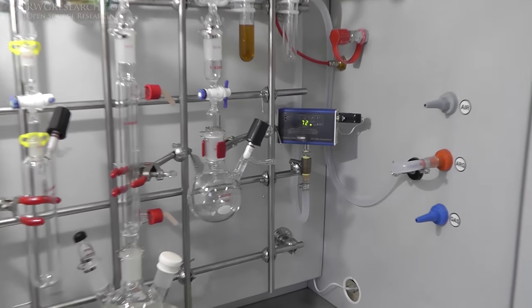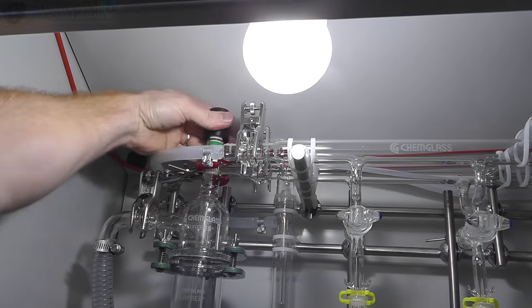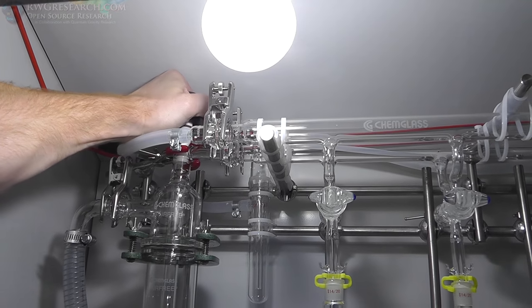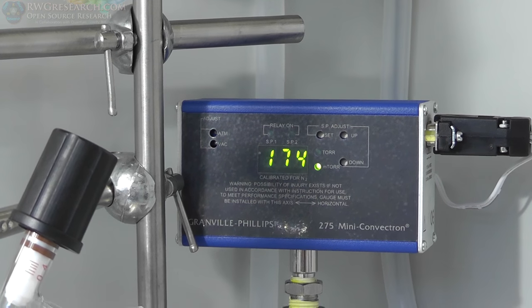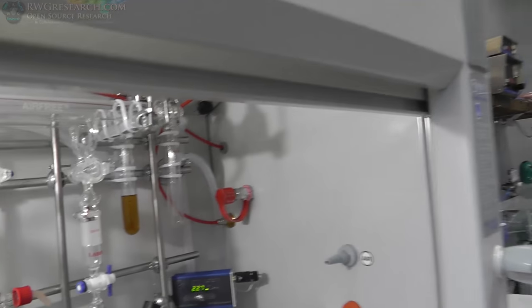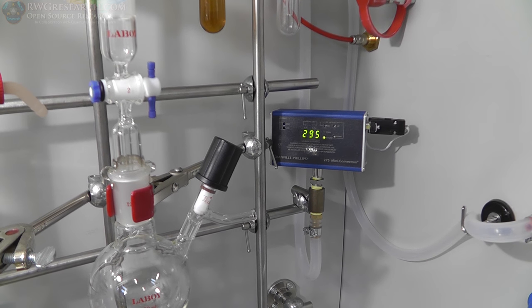Well, we managed to get all the way down to 72 millitorr. Now, this isn't calibrated, so I can't say it's going to be perfect, but basically, for a very quick test, because it's the end of the day, I'm going to close this valve. Alright. You can see it jumped up, so that tells me we have a leak. So we will troubleshoot that. Everything on here might not be perfect, but that is a serious issue that we will figure out. So, anyway, we'll see how high it goes. Probably go all the way up pretty far.